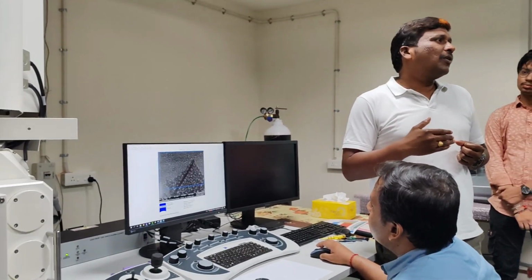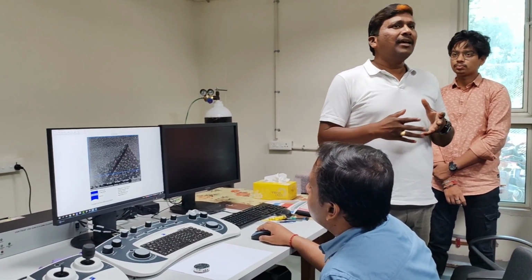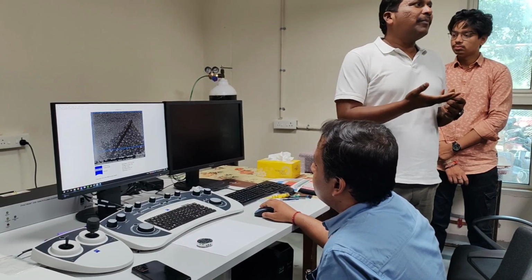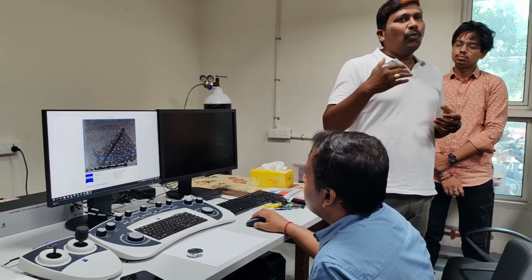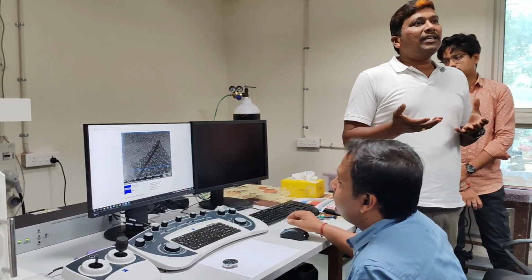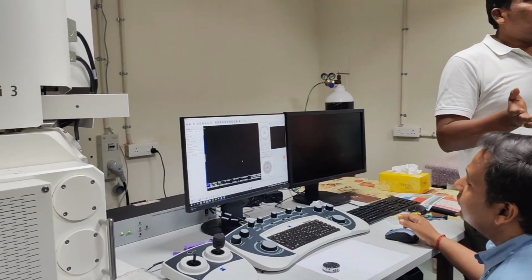No need to go for TEM for all the samples. But TEM has its own advantages. Definitely, the structural information, if you want it, you cannot get with this. But for most nanoparticles, or if you have biological samples, we can quickly get the transparency. Another advantage with TEM analysis is tomography. People do complete 3D information.